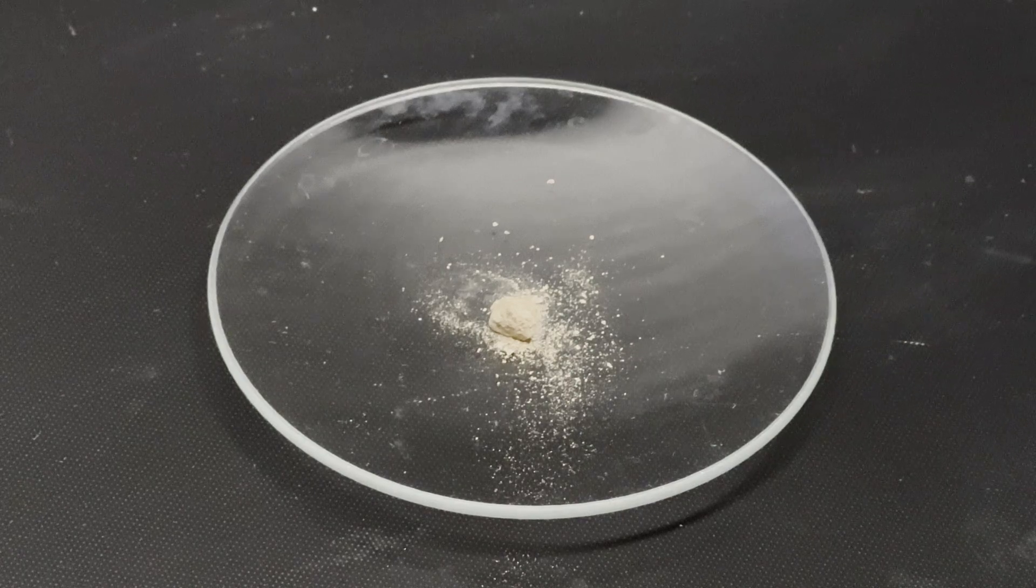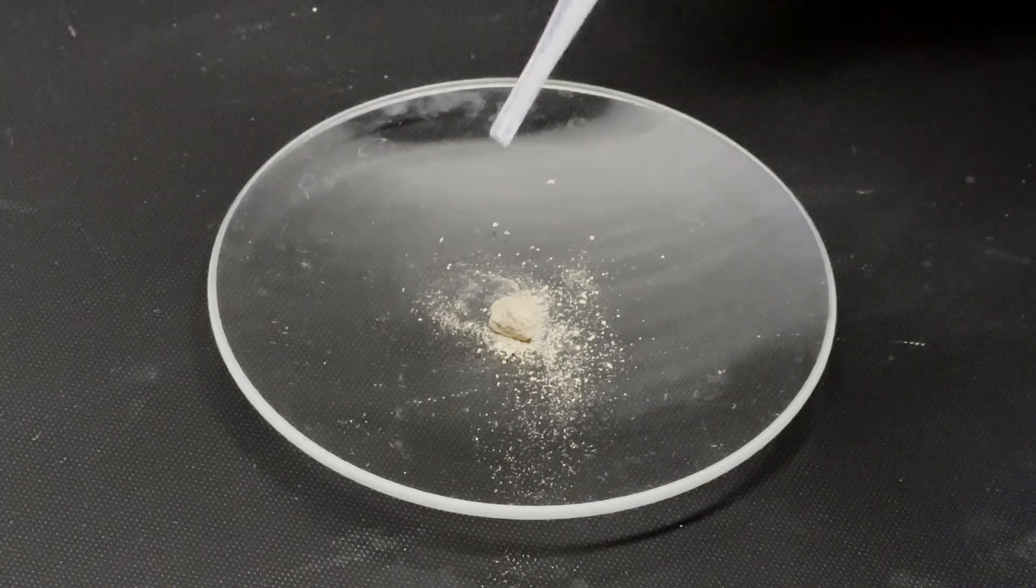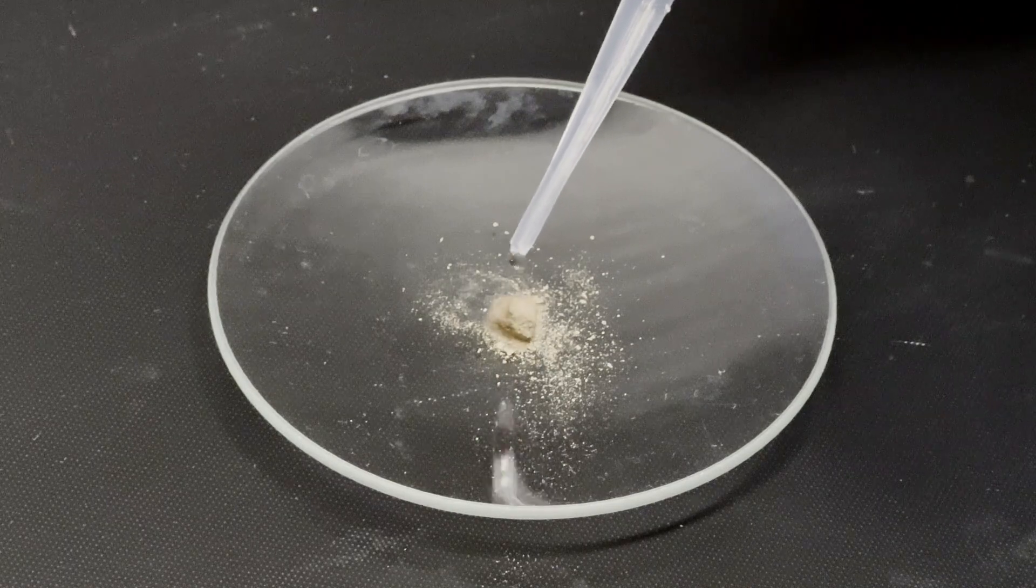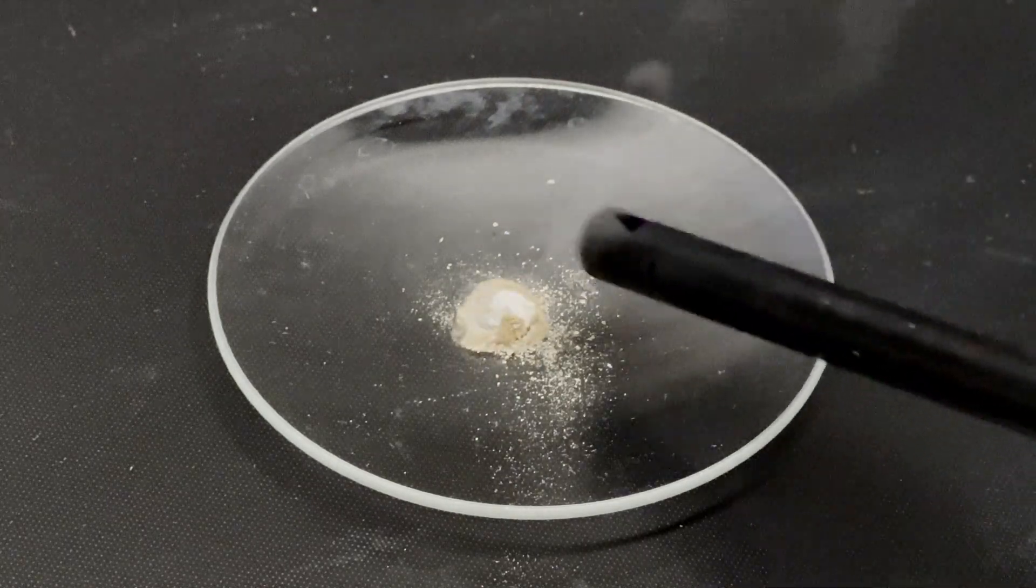This is a chunk of calcium carbide. It reacts with normal water to make acetylene gas, which is super flammable.